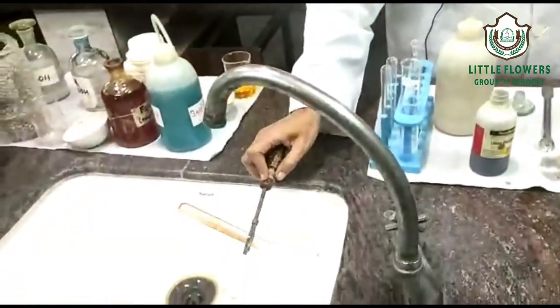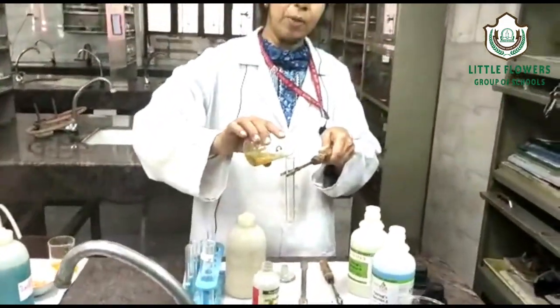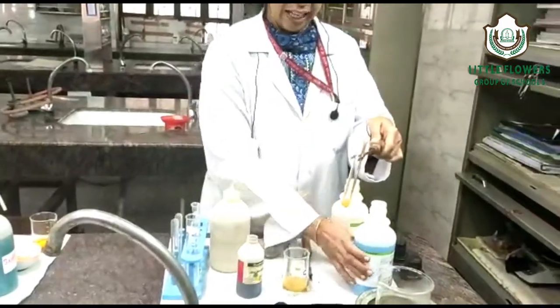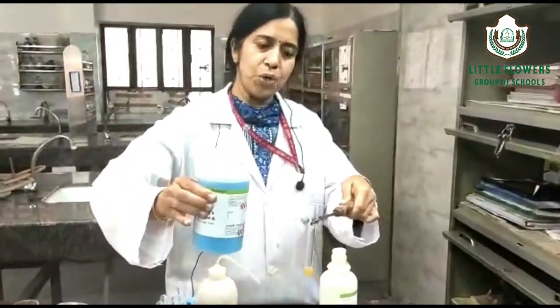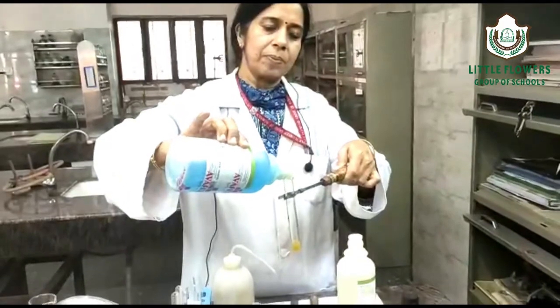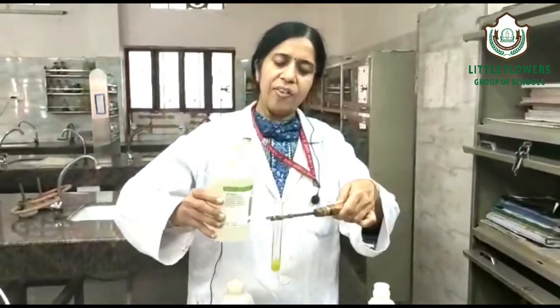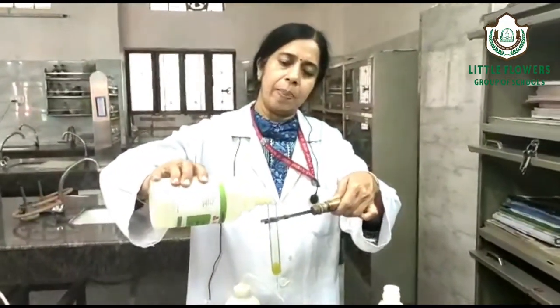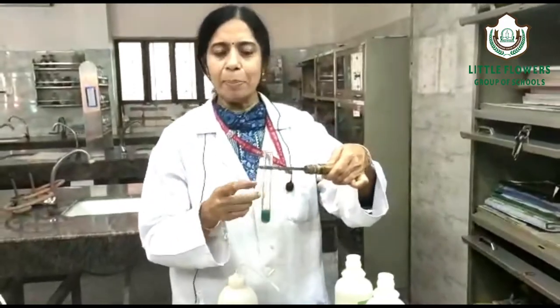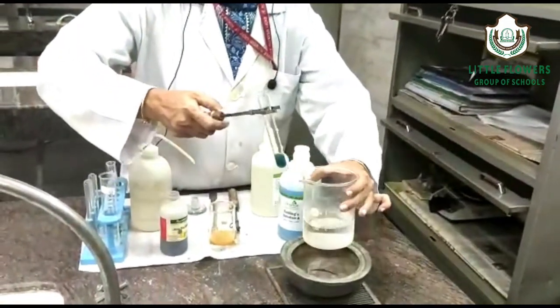Now we do the confirmatory test. We take a few ml of the organic compound and add Fehling's solution A — a few ml — then we add Fehling's solution B — again a few ml. There are some changes, but the test is not yet complete.